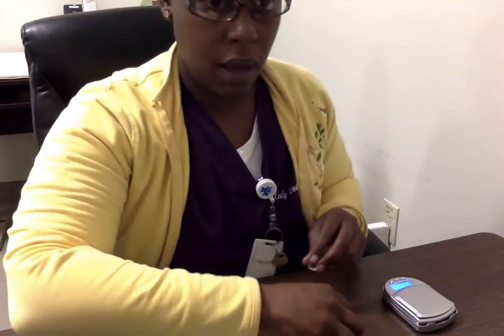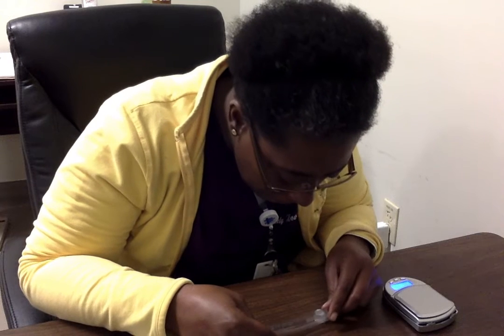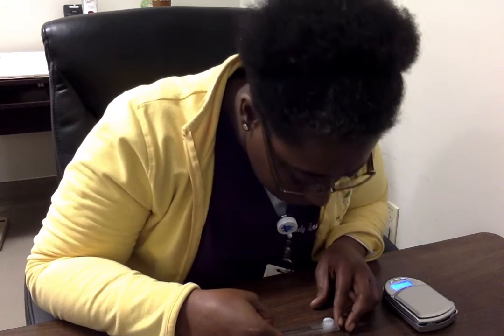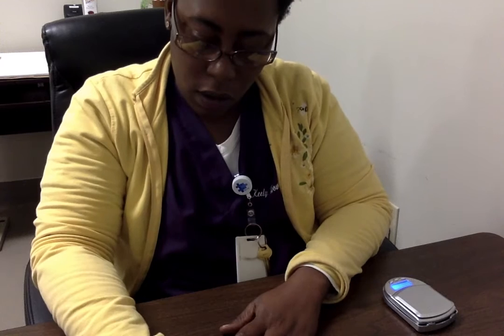We're going to do the same thing with acrylic. Record that down. I'm also getting about 1.2. Again, it's important to go ahead and round down. I'm sorry, I actually just measured the polyethylene. No, I was right, the acrylic, and then lastly, the polyethylene. Again, about 1.2 on the polyethylene. So we want to write that down.